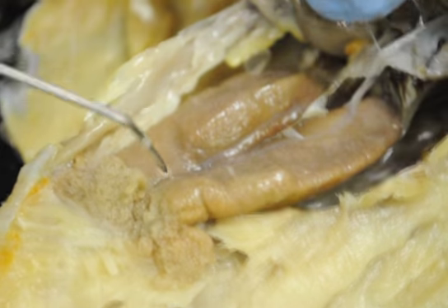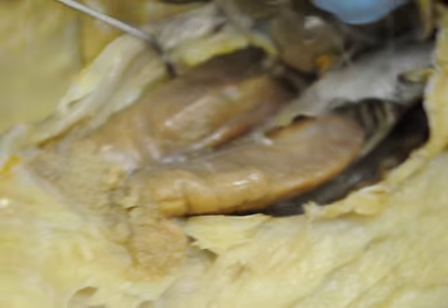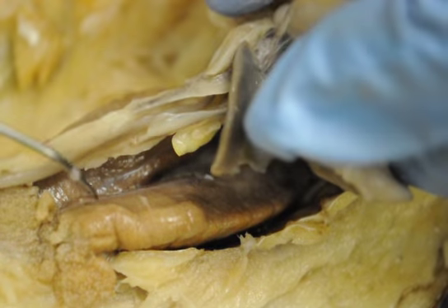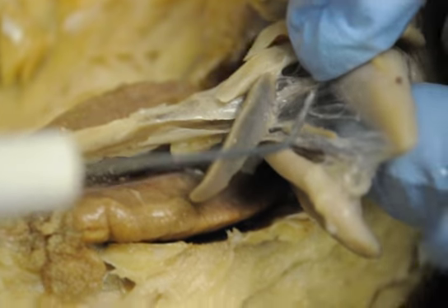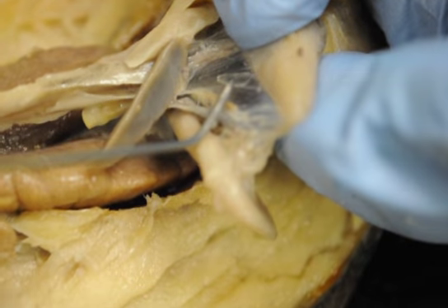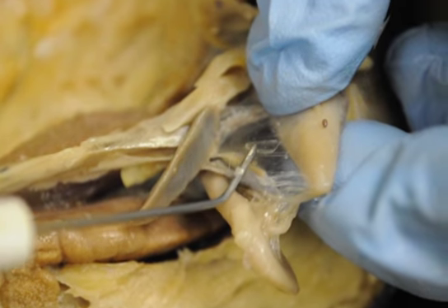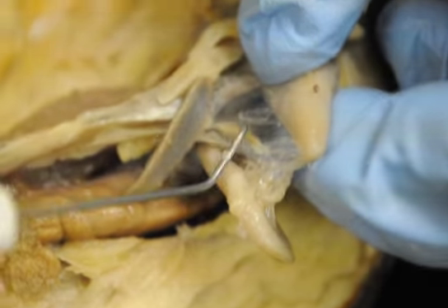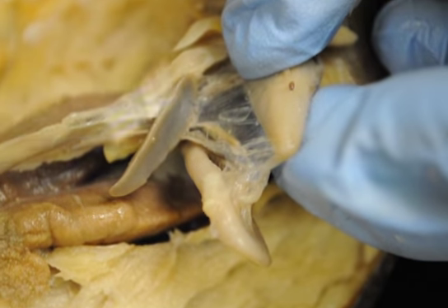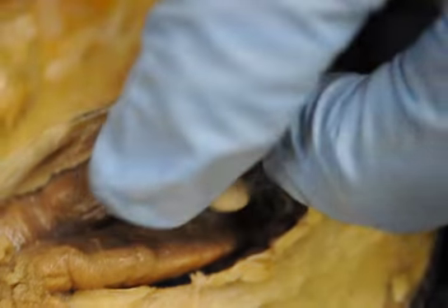Now I can see part of the spleen right here. You can see the spleen. And now this material here, which we haven't talked about in detail in the fish, but we will in the frog, this material is called mesentery. And mesentery is a thin film of material that helps hold the intestines inside the body cavity. We'll talk in detail about mesentery when we do the frog.